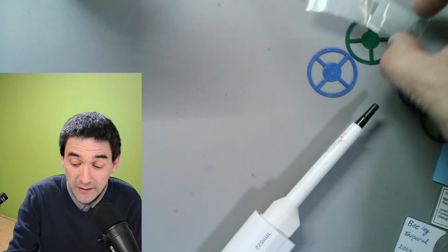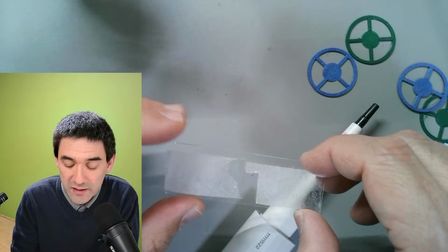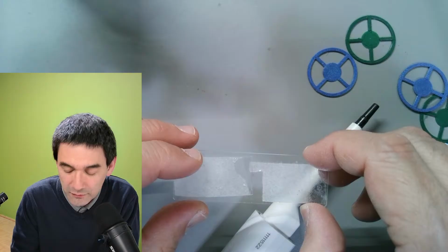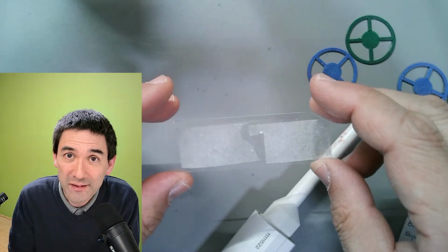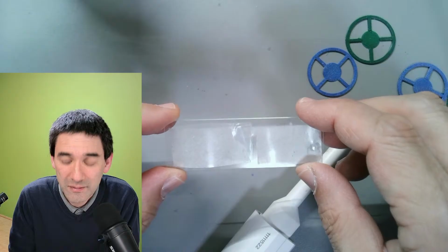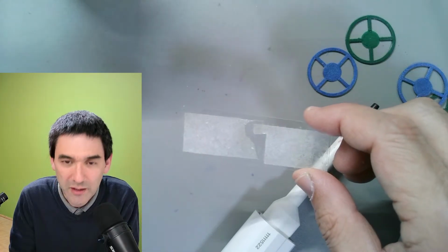Before I do that, this is basically sticky tape, and I collected some dust from my bed and from the mattress of my bed, with the hope of finding some dust mites. This is something that I would really like to find. I have not found them yet, but that's what I'll be looking for here.